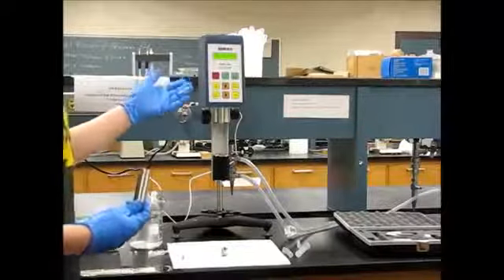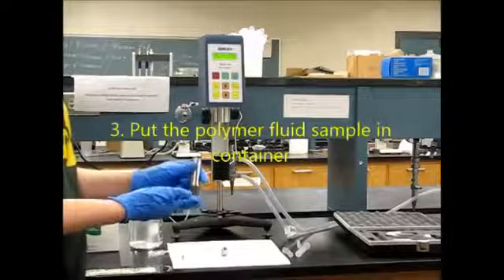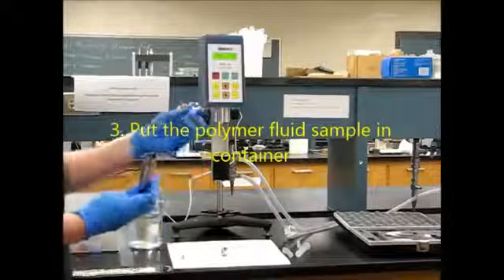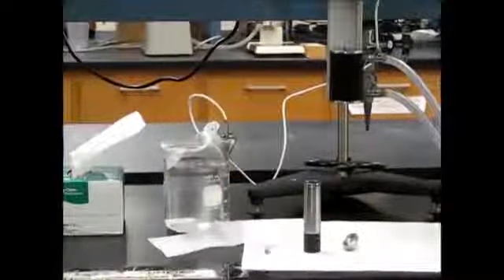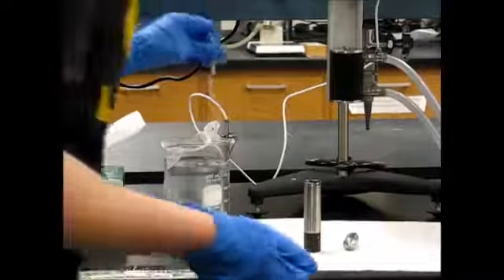So now it's telling us to replace the spindle. But before we can do that, we need to fill our sample container around 25% full with our polymer solution using this. It's going to take about 3 squeezes to get to 25%. Be careful because this fluid is very viscous and it will make a mess.